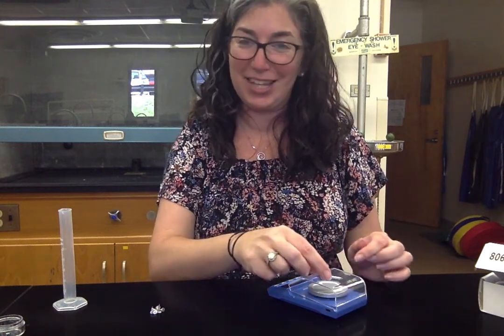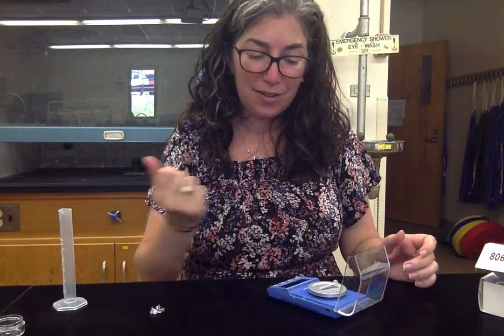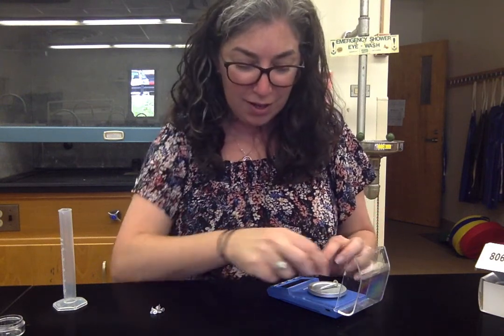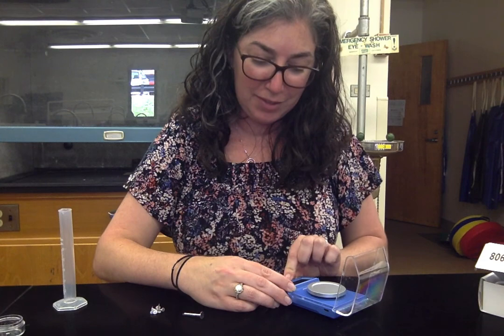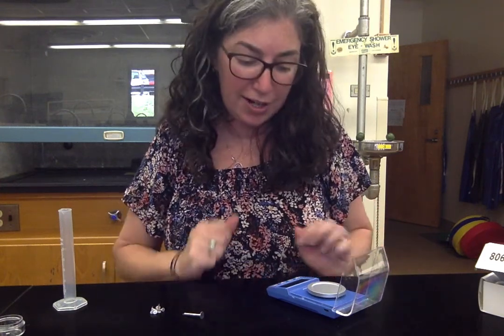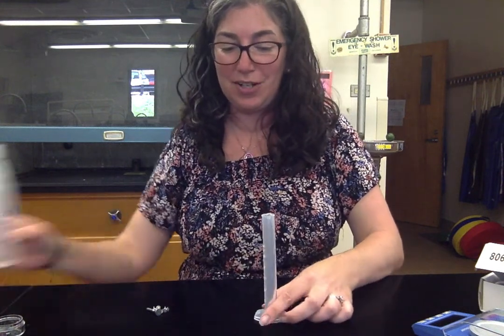I've had students who tried putting things on the lid and it wasn't working. So the first thing you'll do is put your nail on the scale and record the exact mass you see. It should be reporting in grams. If it's not, hit the M button to change the unit until it reads grams — grams is the one all the way at the far right. If it's not reading 0 when you turn it on, hit the T button. T is for tare and that will return it to 0. That's how you take the mass.